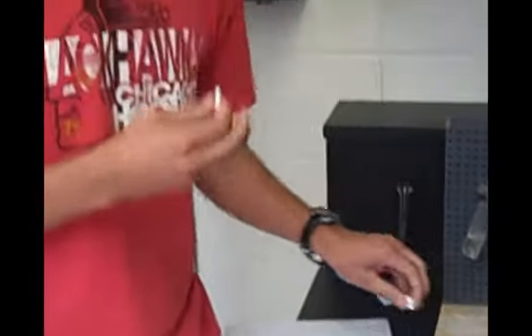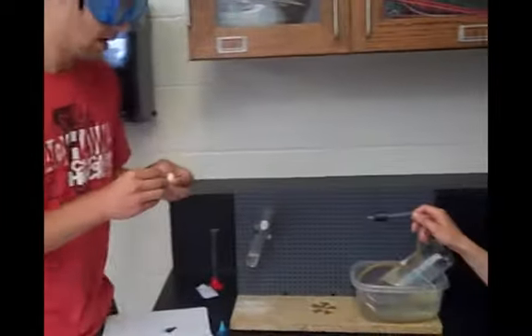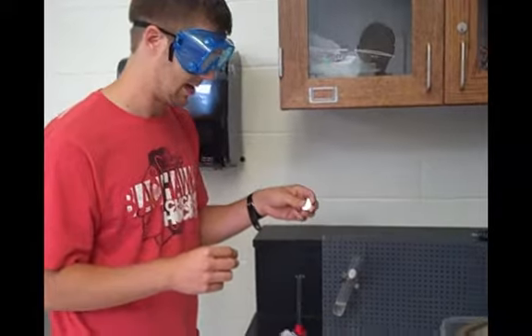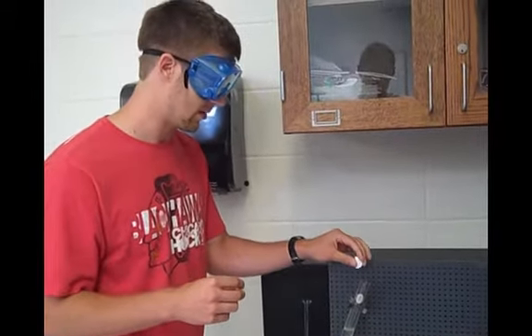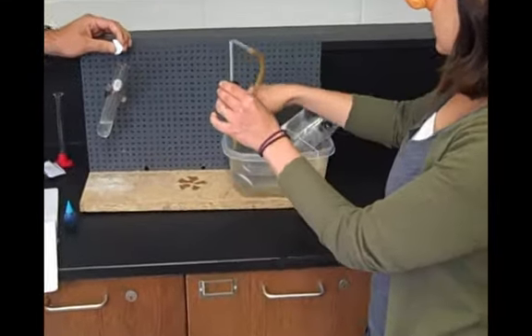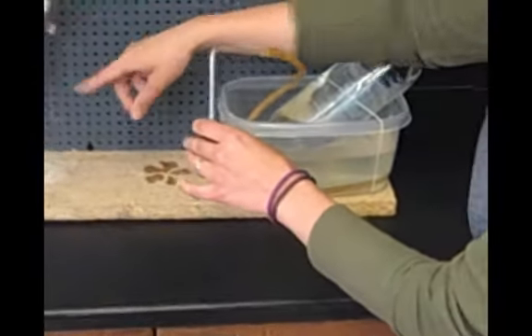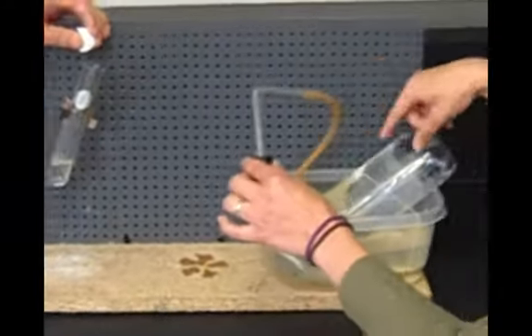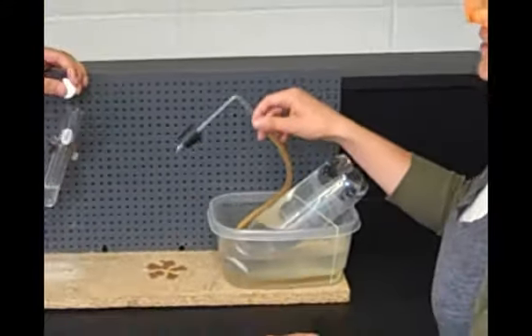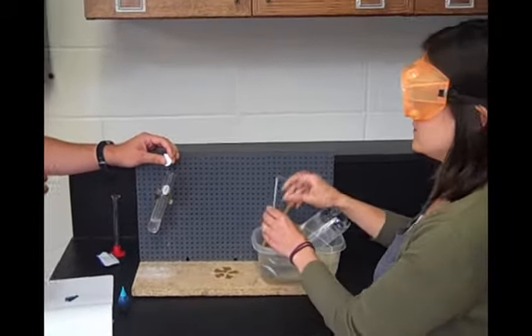Then we're going to have to coordinate as partners to make sure that when I'm putting this in there, Miss Berna is going to put the stopper on there as fast as she can so we can collect as much of this gas as possible. After we put the stopper on, we want to let a couple bubbles come out of the tube so that we're not collecting any of the atmospheric air that's in the test tube or in the gas collection apparatus. And then we'll try to get the tube up to the top of the collection bottle.